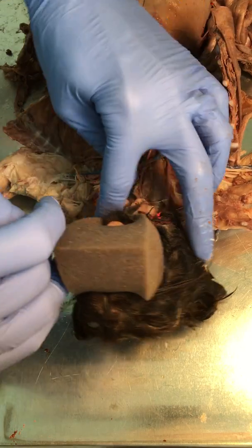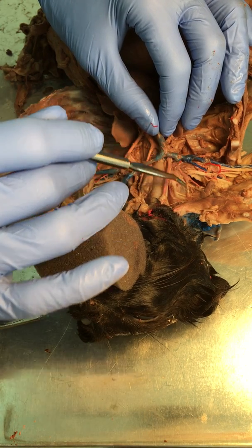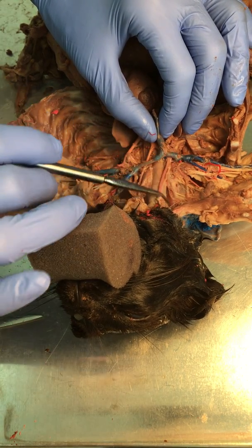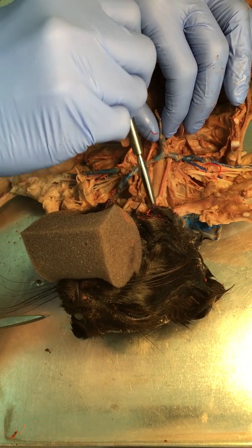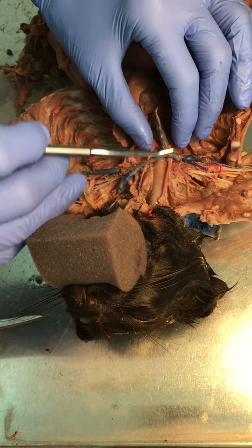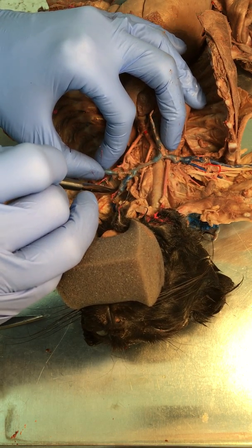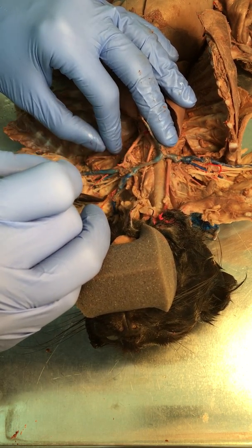But what I try to do is follow the vessels up, and the external jugular is going to go to the outside of the face, like right here, and the internal jugular is going to kind of come up along with this common carotid, and it's going to go into the head deep, so right up along that central line. All right, so once we get past this branch for the jugular, you're going to have branches into the arm vessels, and so we'll get to that in a minute.